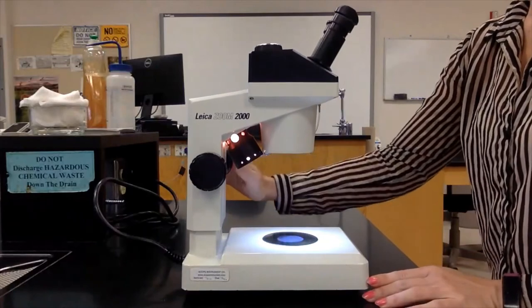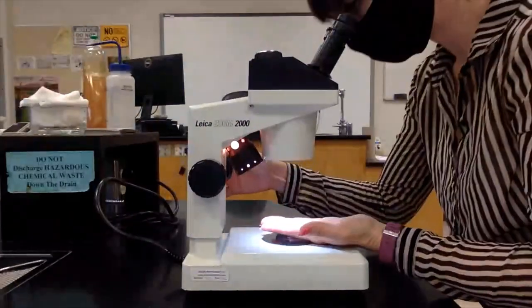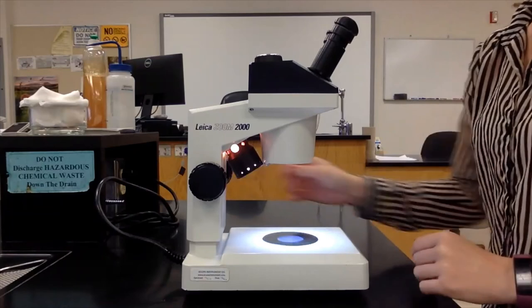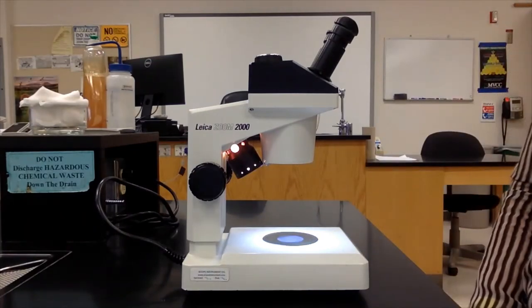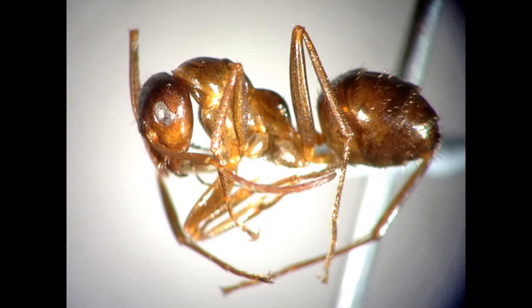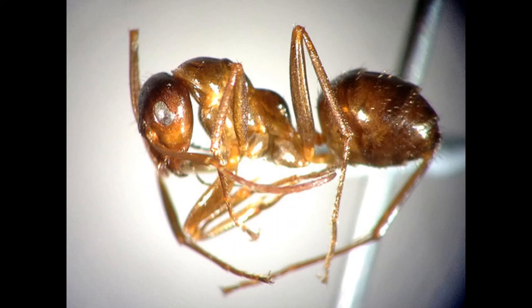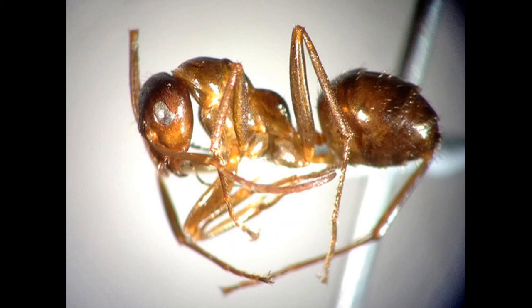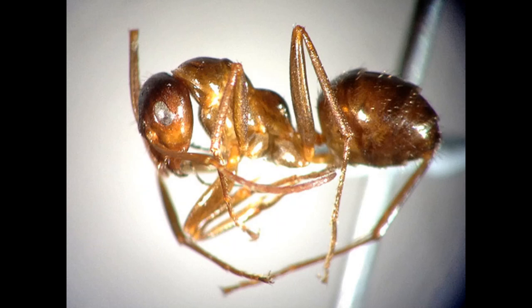What the coarse adjustment does is bring the microscope up and down, moving the objective lens further or closer to your specimen. This ant can be seen many times larger under the stereoscopic microscope than with our naked eye — fine details can be seen such as the hairs on its abdomen, and even little hooks on the end of each leg. But if we want to see things even smaller, like the cells the ant is made of, then we'd want to use the compound microscope, which we'll cover in part two of this video series.